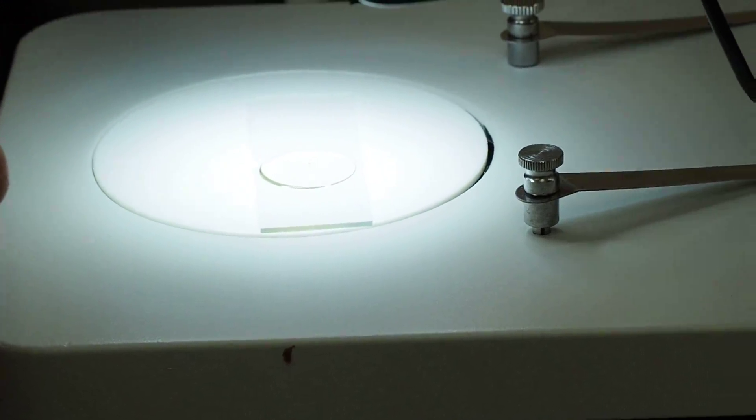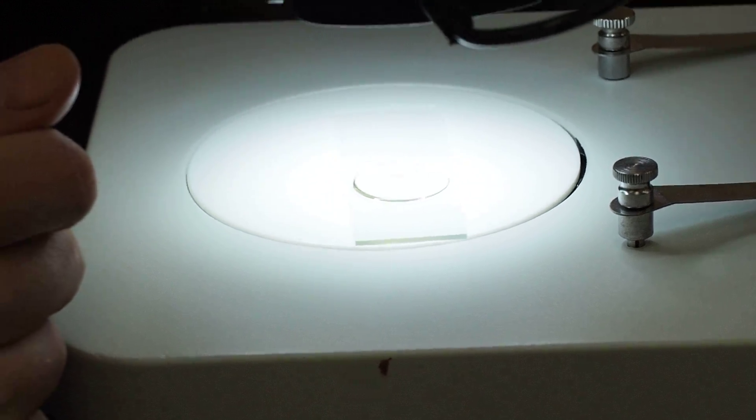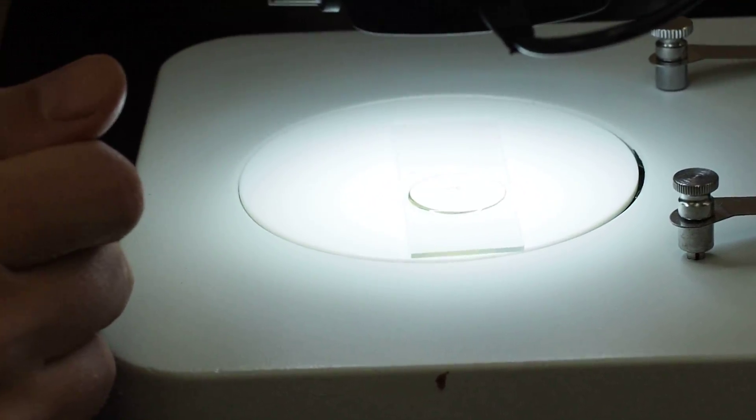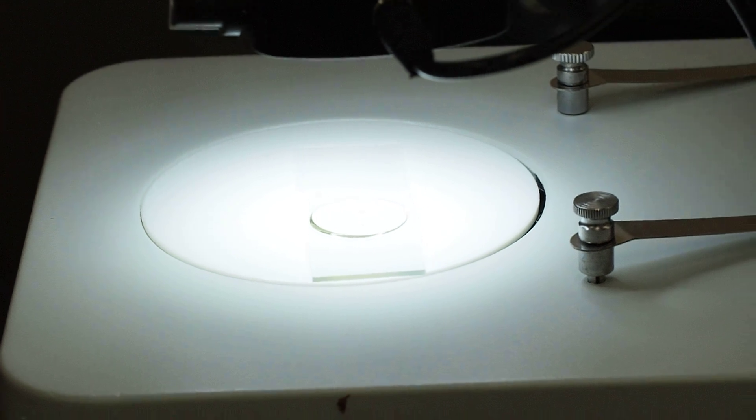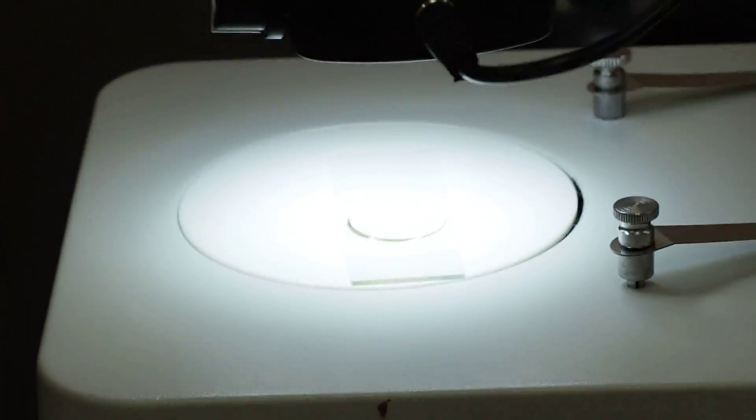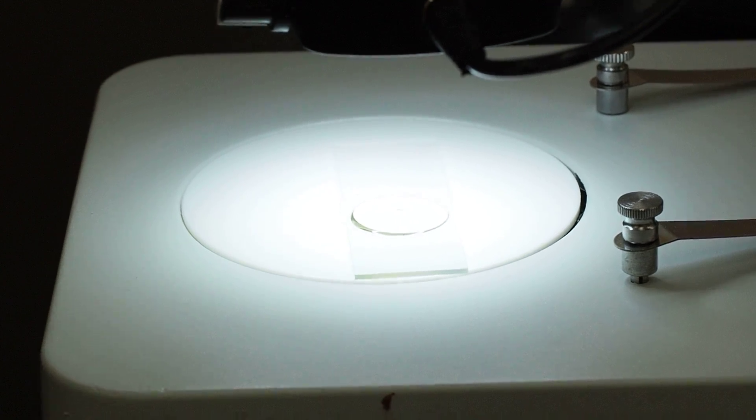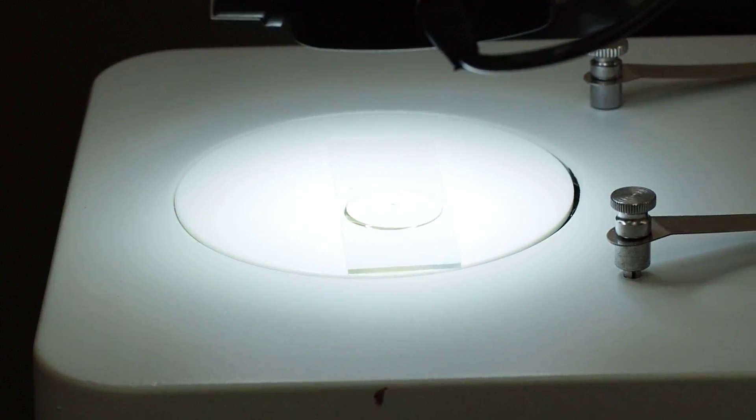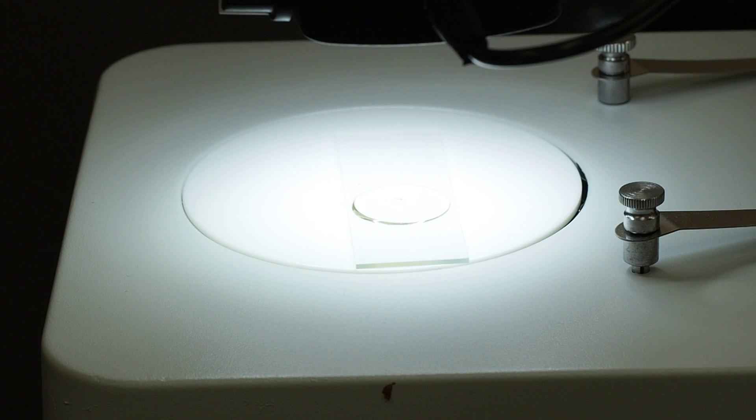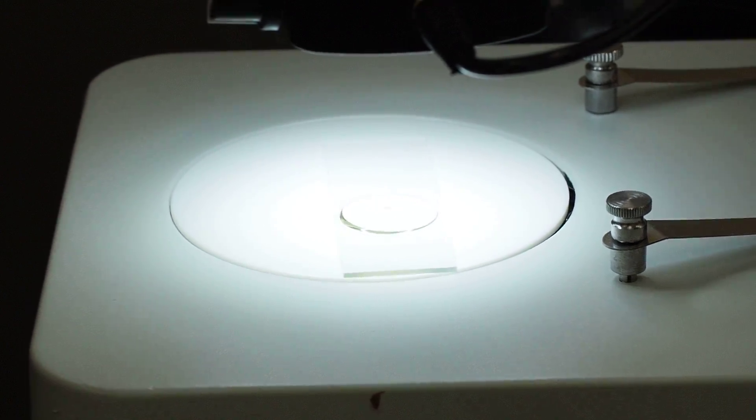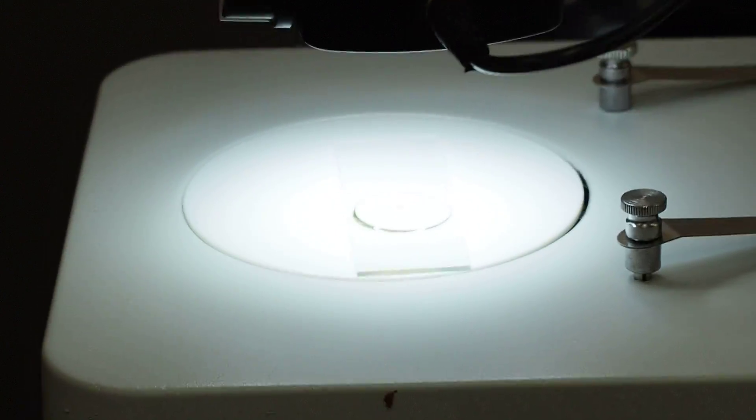And that's about it, and that's it. And so this one now is mounted and it'll probably be a long time before it's completely hardened up. It could be a couple of years or more, especially with the amount of clove oil that I added, be a really long time. So yeah, that's it, that's a slide mount preparation.